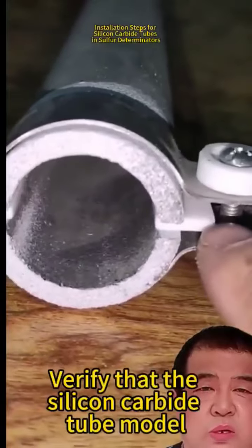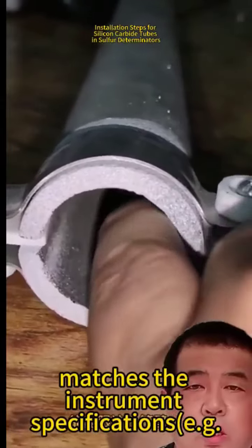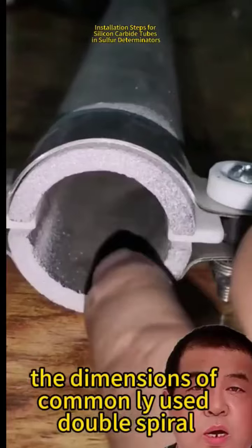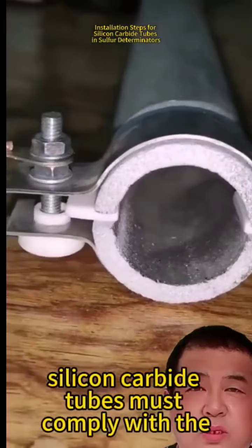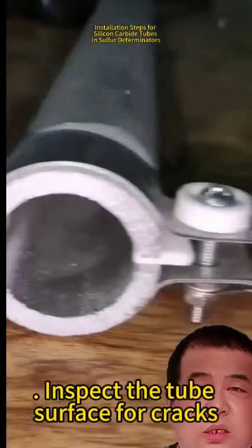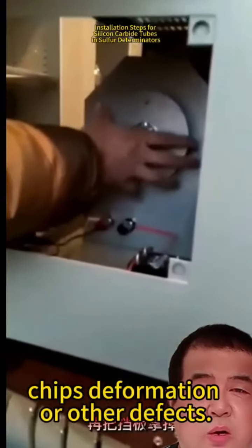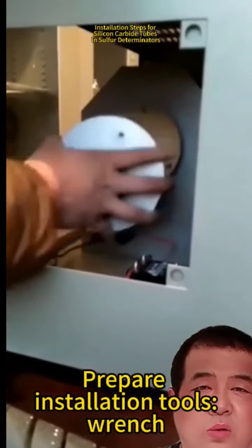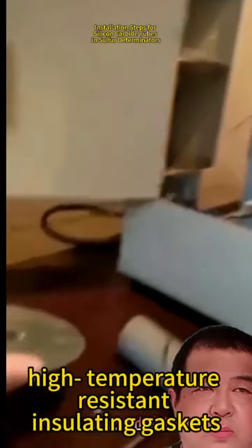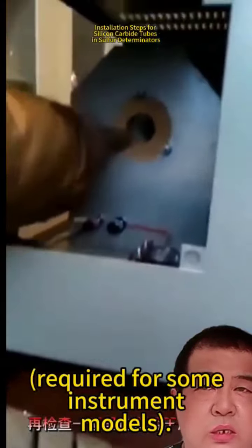Preparation work. Verify that the silicon carbide tube model matches the instrument specifications, e.g., the dimensions of commonly used double spiral silicon carbide tubes must comply with the furnace chamber size. Inspect the tube surface for cracks, chips, deformation, or other defects. Prepare installation tools: wrench, high temperature resistant insulating gaskets, and quartz sleeves, required for some instrument models.